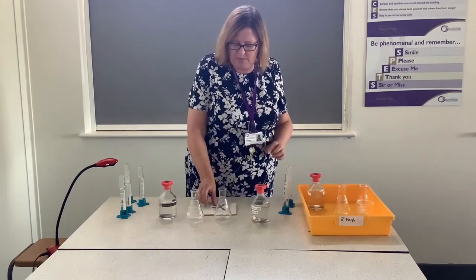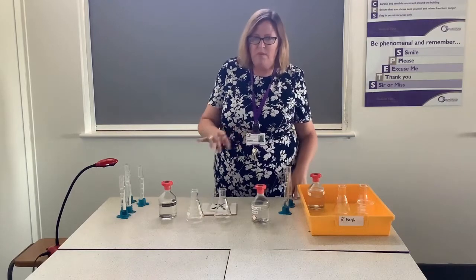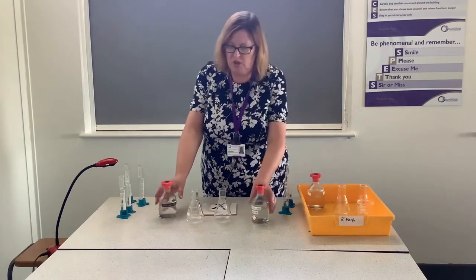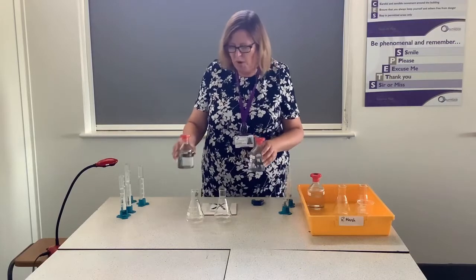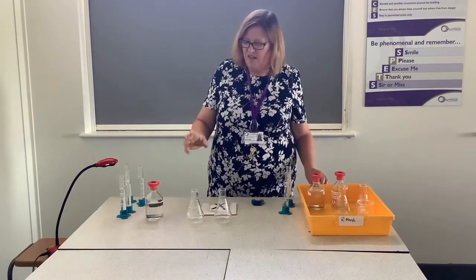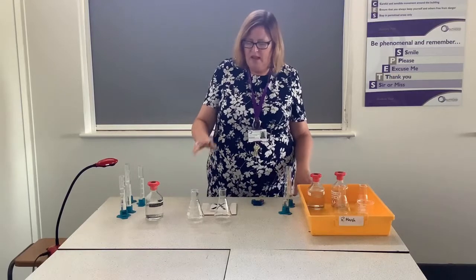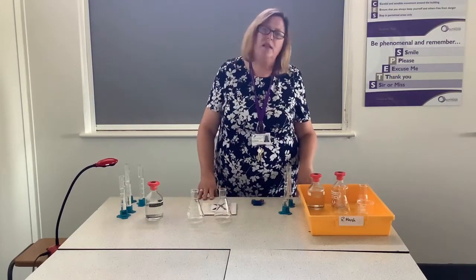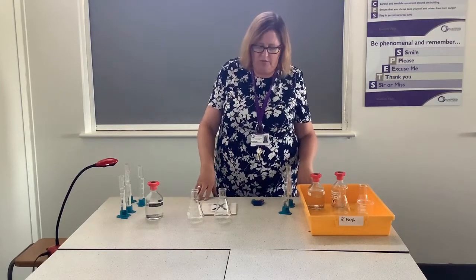The reason that we can use a disappearing cross is because when we mix these two chemicals together and they react from two colourless liquids, one of the products that we make is actually a yellow solid. As the yellow solid forms, it will gradually become opaque in the solution and we will lose vision of the cross.